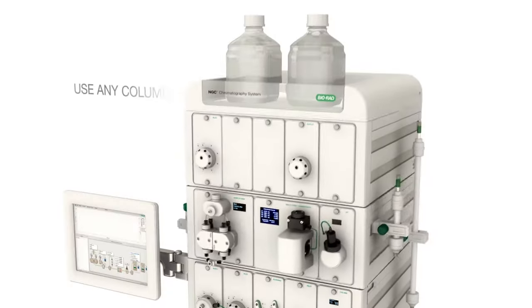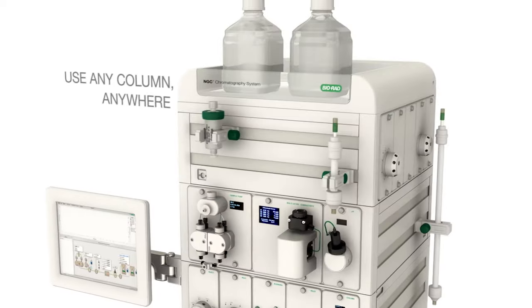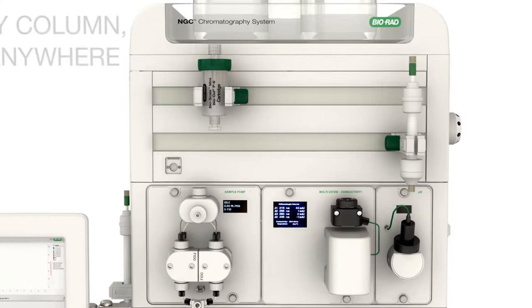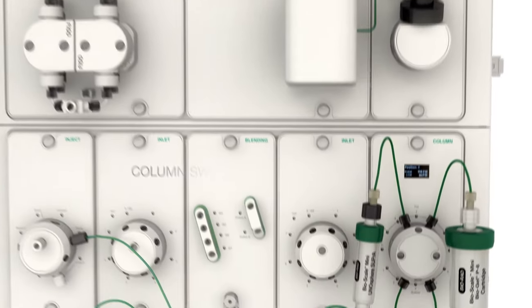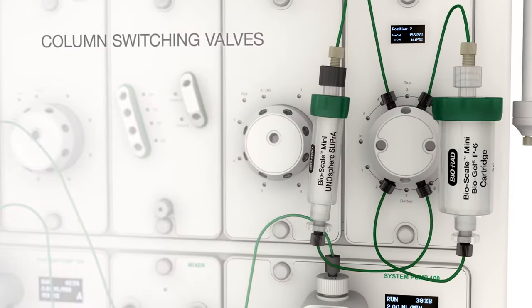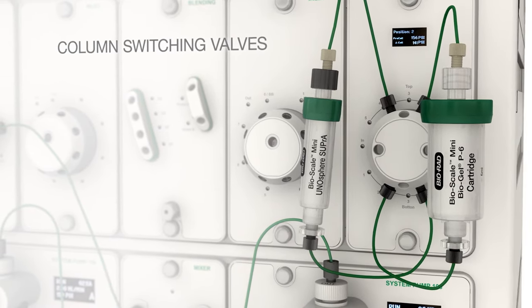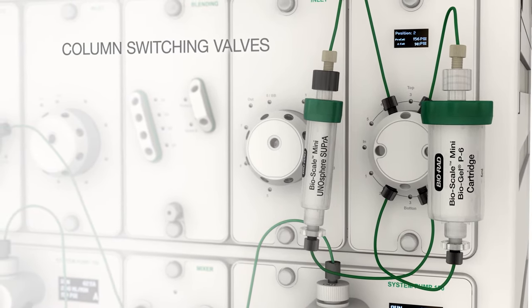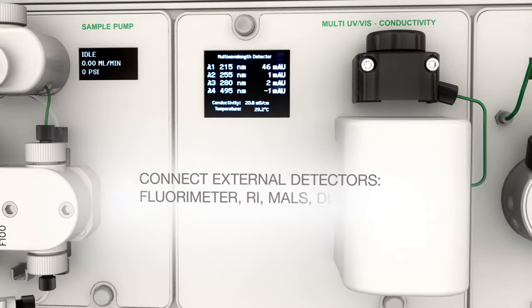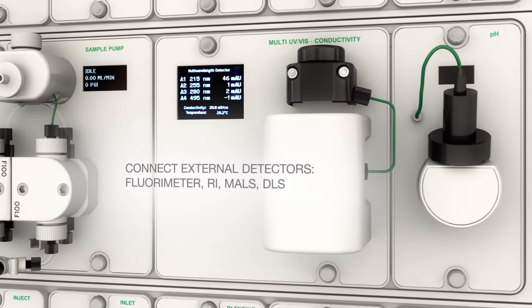Place columns anywhere, and with tier rotation, reduce dead volume for tighter peaks. Column switching valves can reverse flow for affinity and cleaning. Columns can be left in line to prevent air ruining your column. For further protein characterization, other detectors can easily be connected.